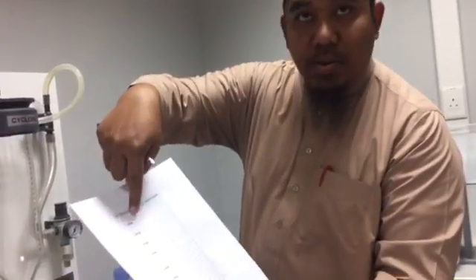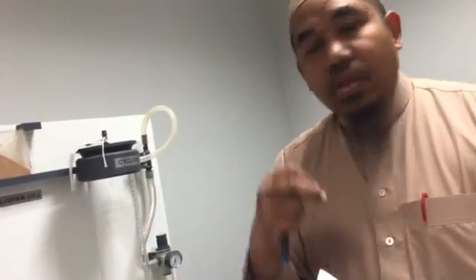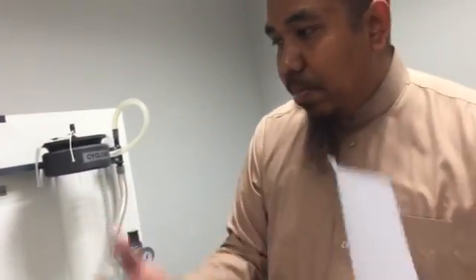When you do this experiment, you repeat with wet condition and see how the angle changes. Understand? Yes. So the first thing that you have to do is this one. You finish this one, choose 3 samples, take the angle, and then combine in one.